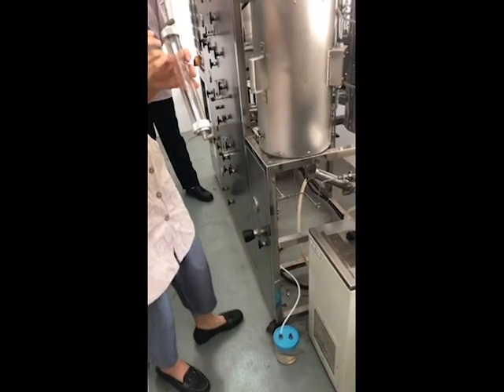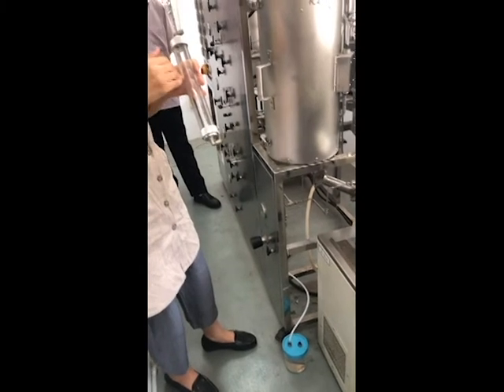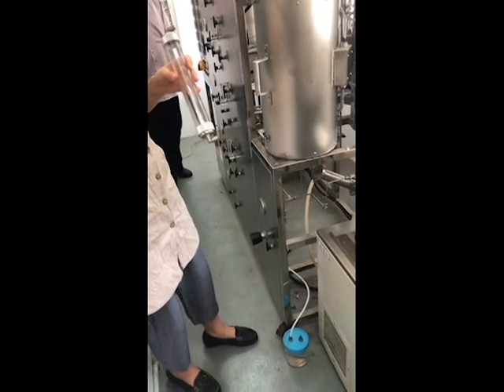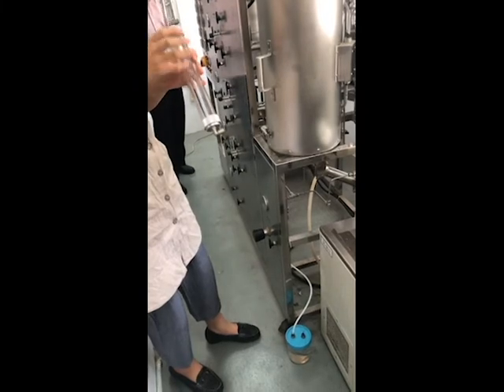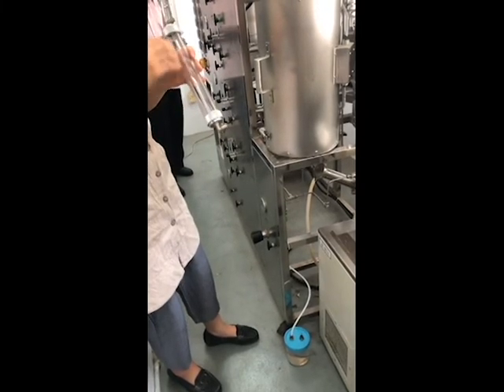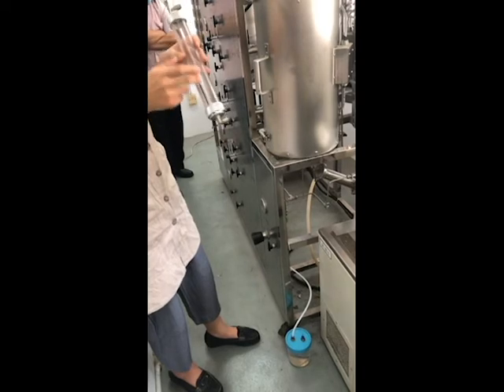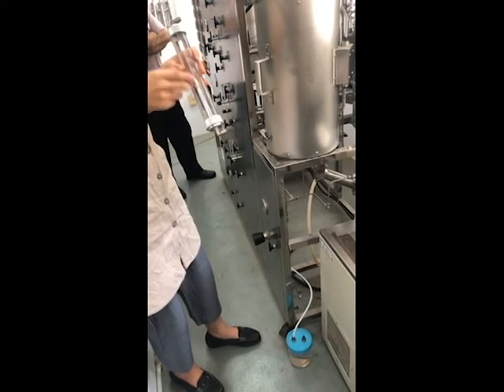But no matter what kind of purification you use for your products, it must not affect the components of your gas mixture, because you need to maintain the percentage of all the gases. You just remove the humidity, but you must not affect the rest. Some absorbents react with certain gases, so you must be careful.